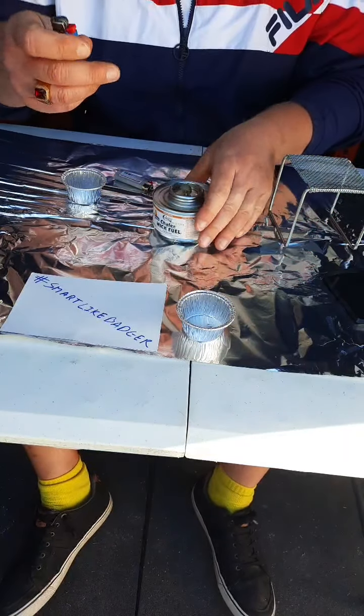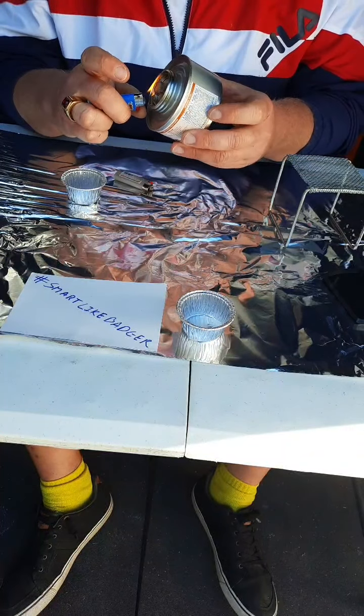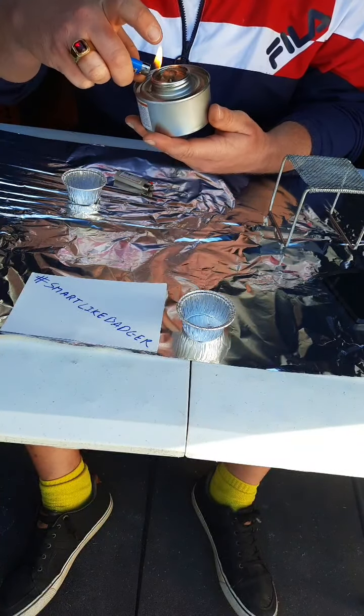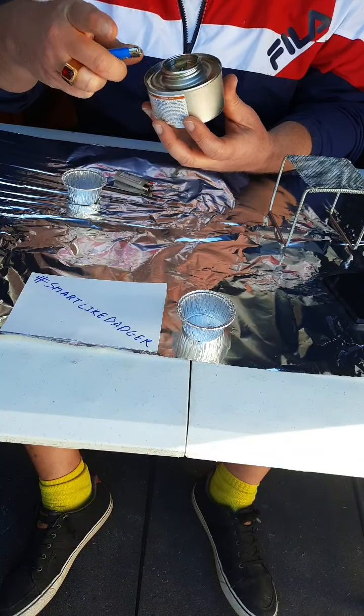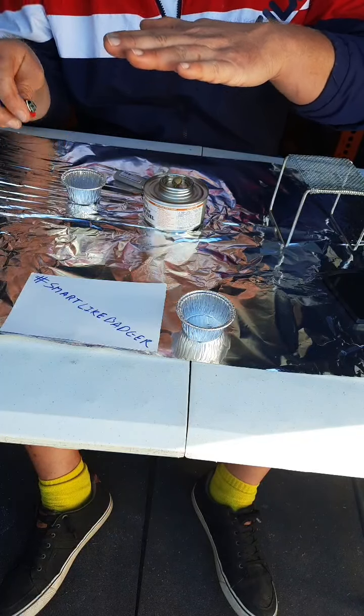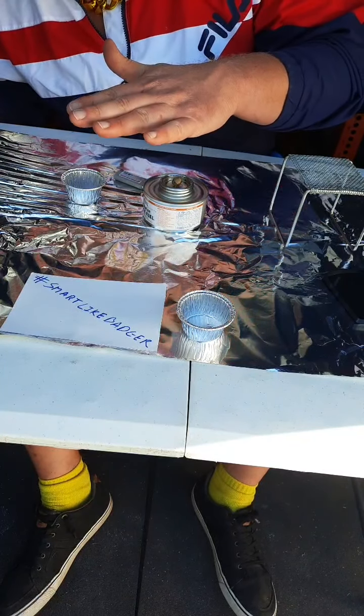And we are back. Let's light this flame. Now, one thing about this lantern is the flame is often invisible. So it's going. I see it's going right there.